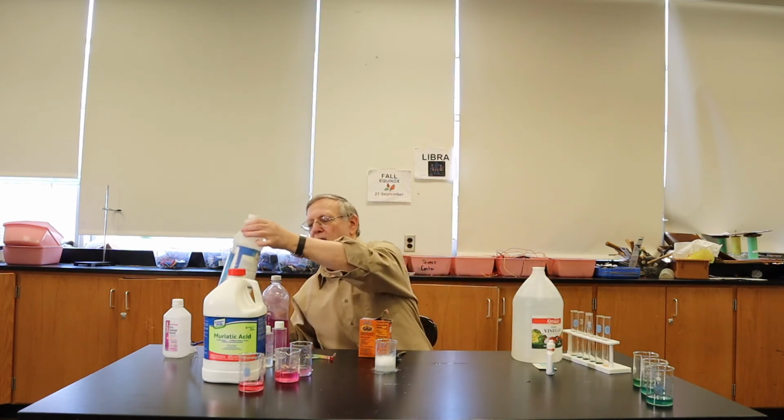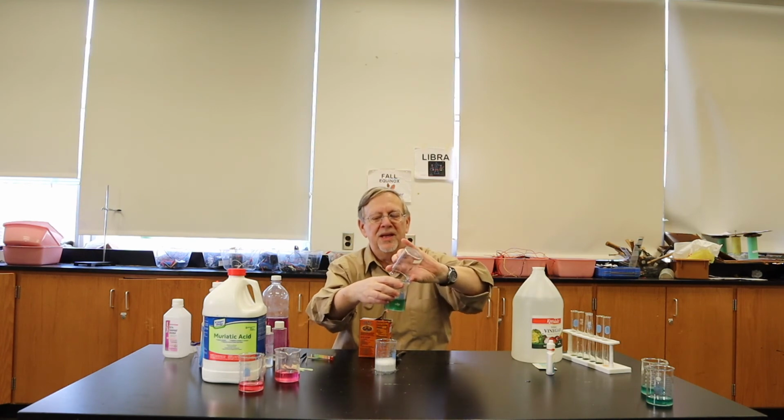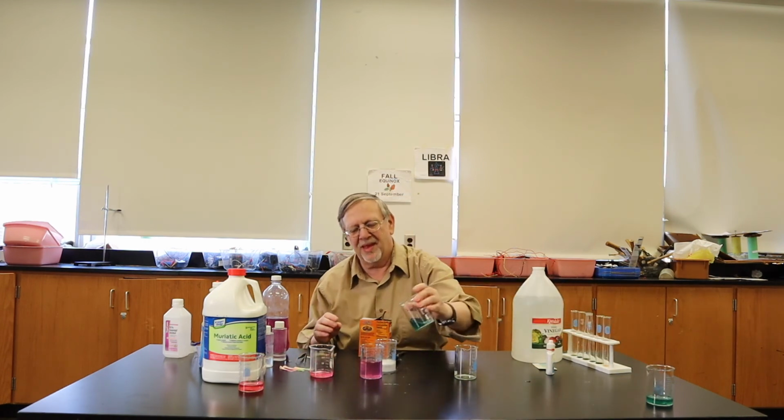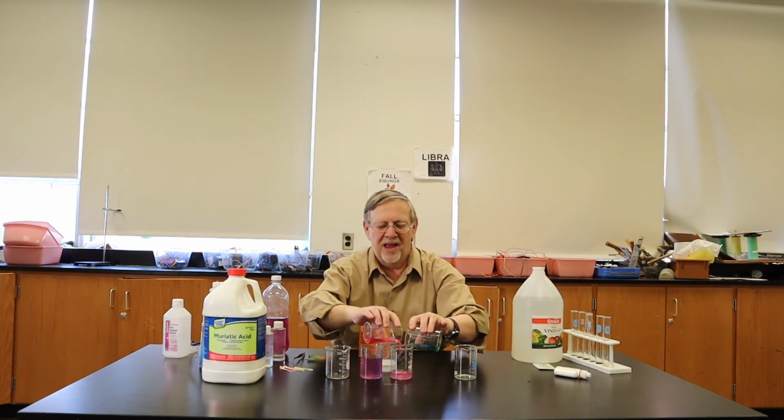You could actually do the same thing with the beakers of color that we've done. Mix an acid with the base and see what happens. And you get all different kinds of different colors that show up. There is the purple. There is the dark purple. There is the red, showing that this is still an acid. Bubbles are forming, carbon dioxide bubbles are forming, and you are beginning to neutralize the acid with the base.